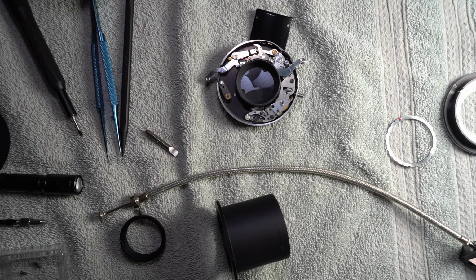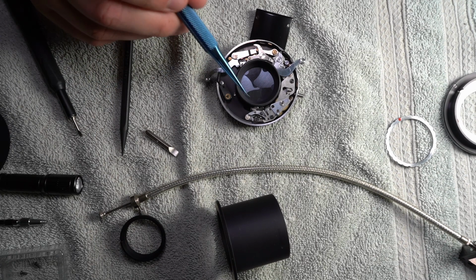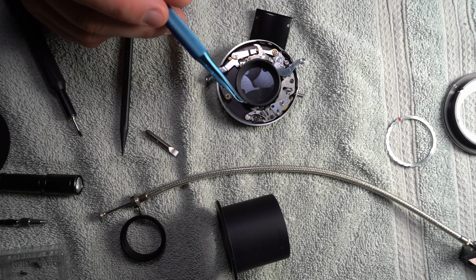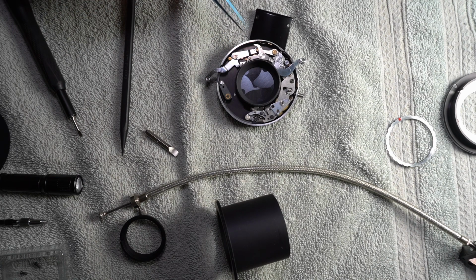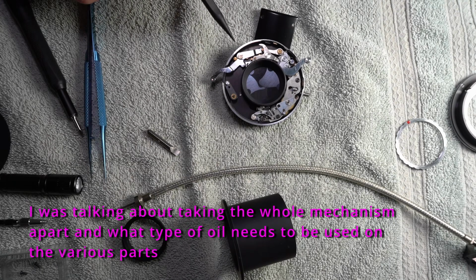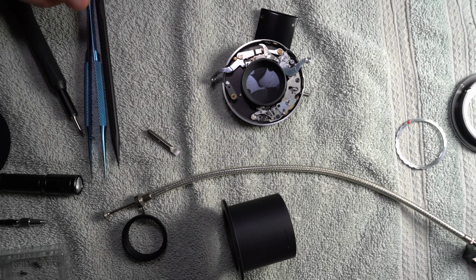I don't have the correct type of grease, and I also don't have the correct knowledge, or I would go in here and take this whole thing apart and put it all back together and actually oil the whole thing. This movement is 50 to 65 years old, because it was built in either the 60s or 70s. I think 90-20 was the really thin oil that you needed for all these really fast moving parts. Again, that's beyond me. I don't do that.